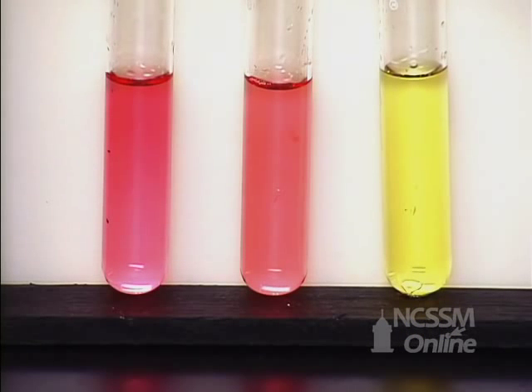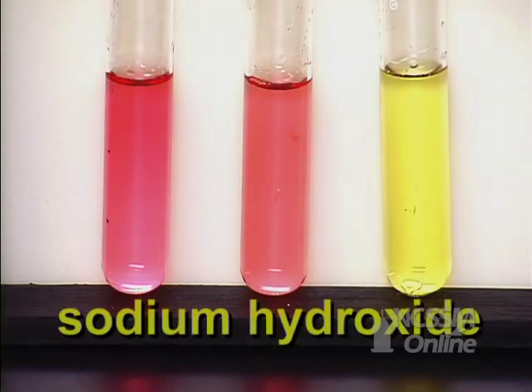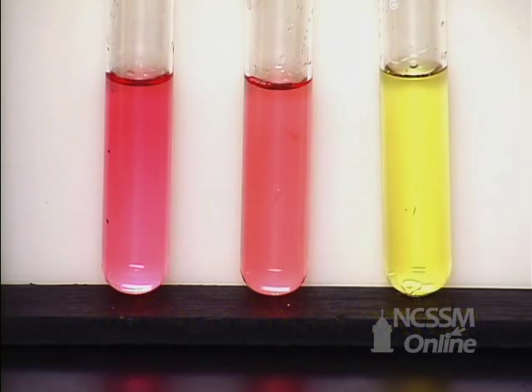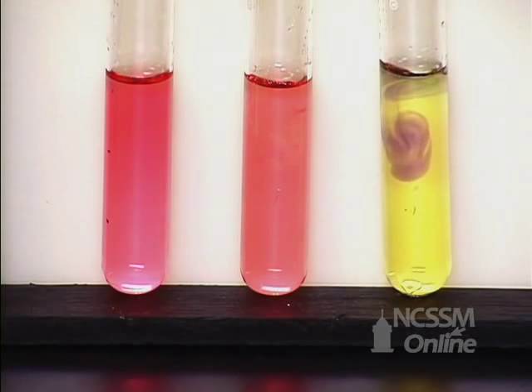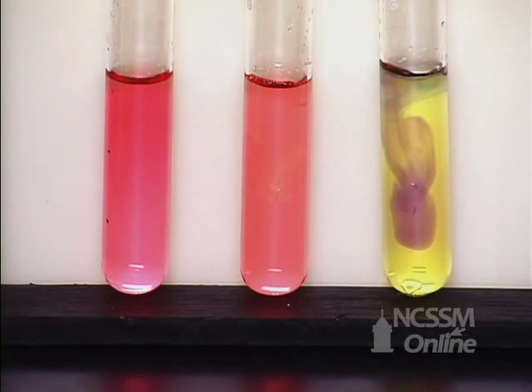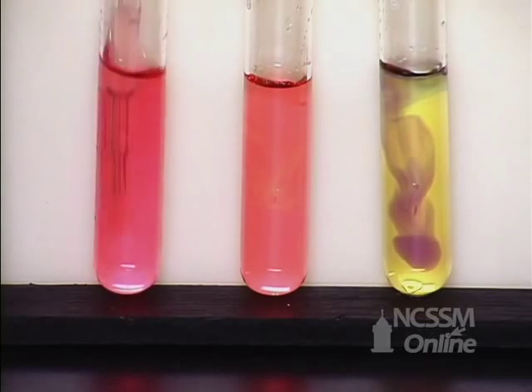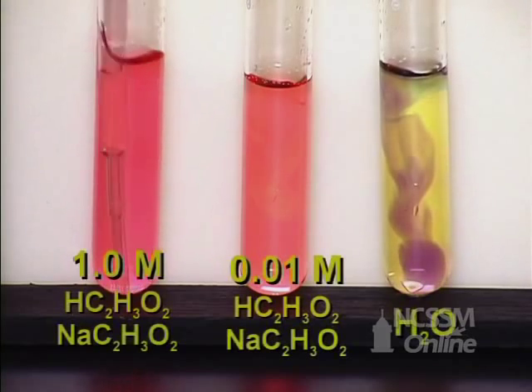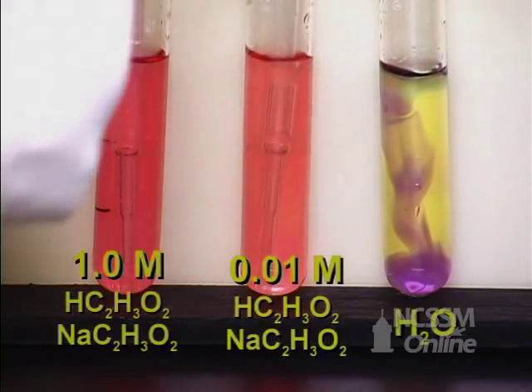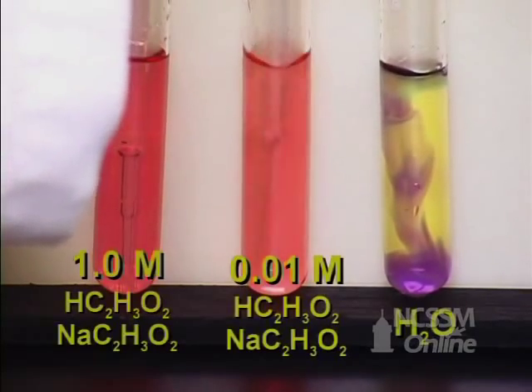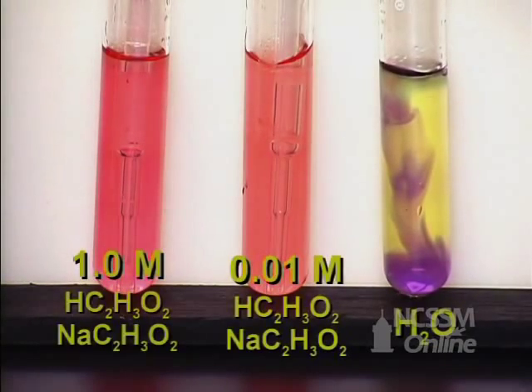So what I'm going to do is add sodium hydroxide, 0.1 molar. And I want you to observe what happens in each one when I add only one drop of 0.1 molar sodium hydroxide. In the first test tube, you see virtually no change. And the second test tube, virtually no change.